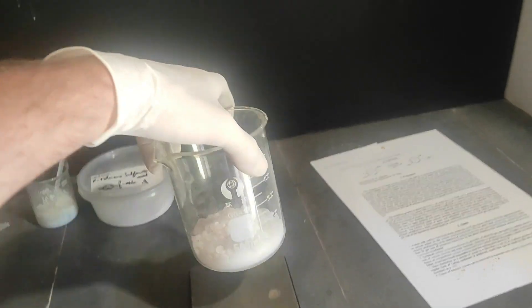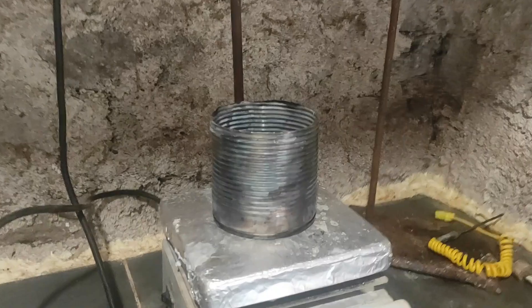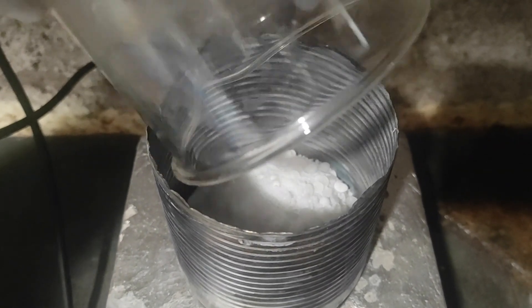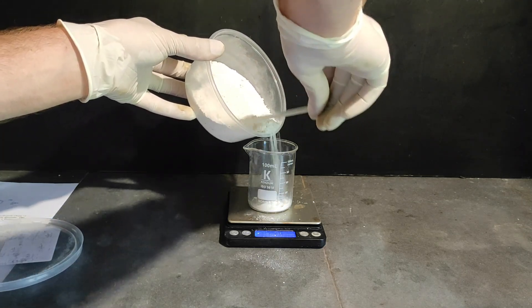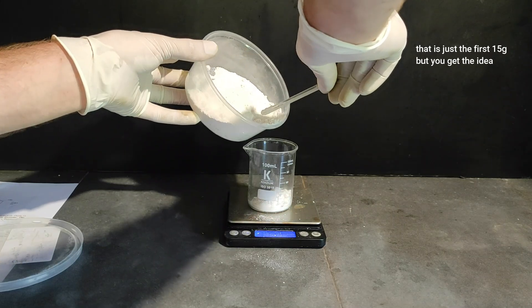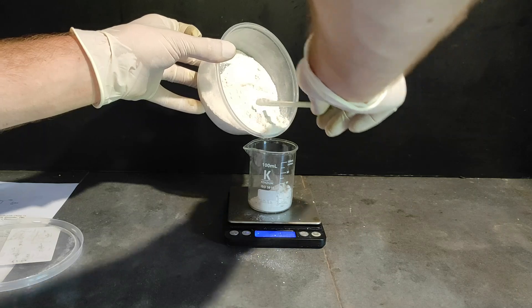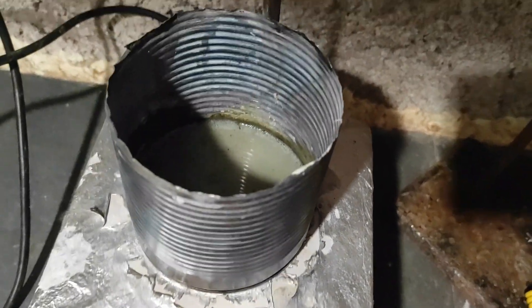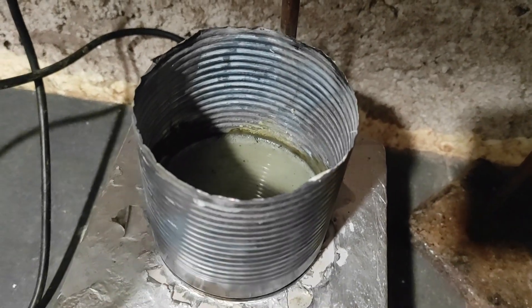Anyway, I added all of the hydroxide to this iron can and started heating to the maximum. The idea is to first melt them together before starting the reaction. In the meantime, I measure the sodium para-toluenesulfonate. The paper says you need a first portion of 15g and then another one of 45g, so 60g total. When the hydroxide mixture is melted together, you either need to cool it down or heat it until it is at 230 degrees.